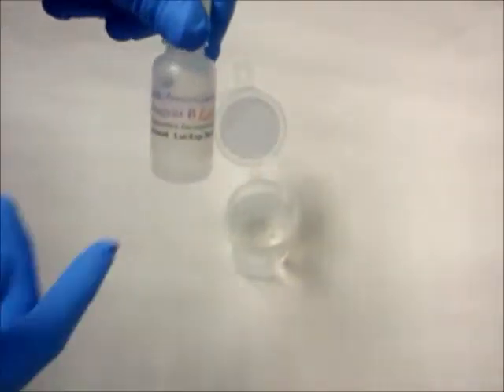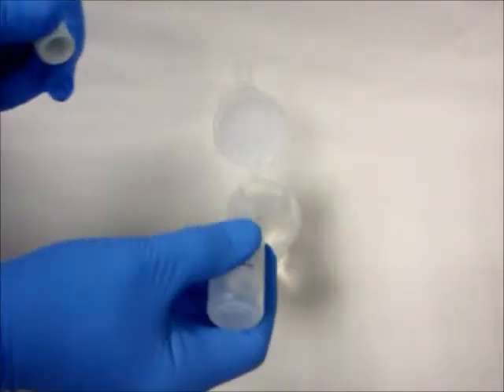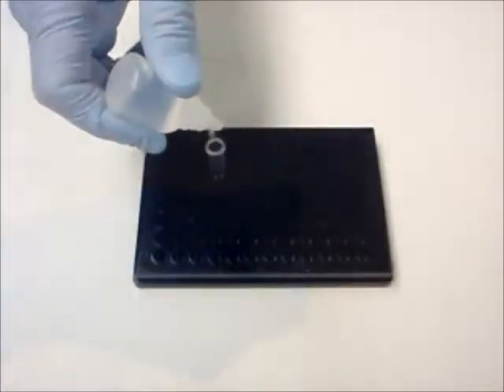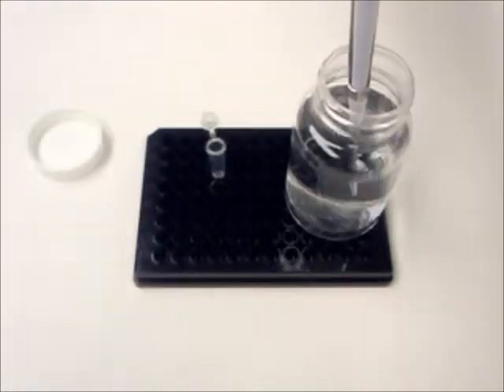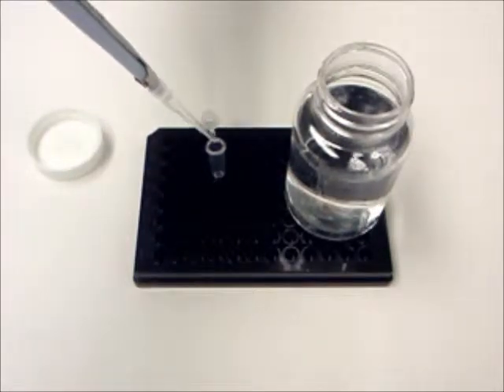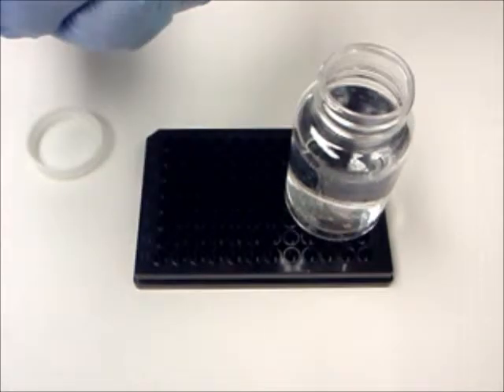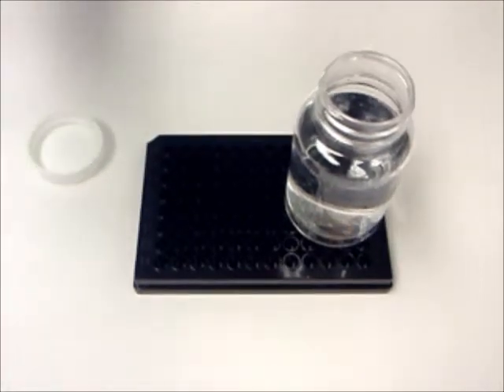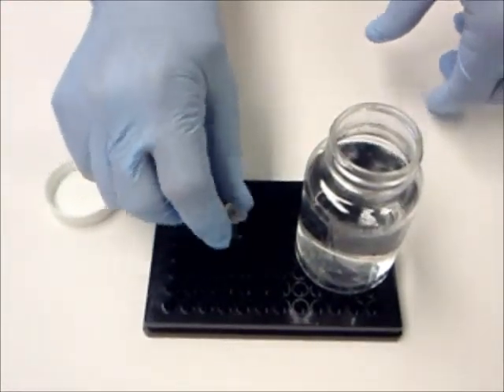First, collect your 100ml sample and add 4 drops of Reagent B, the enzyme inducer. Add 3 drops of Reagent C, the lysing agent, to the plastic mixing vial. With a disposable pipette or pipette tip, pipette 175 microliters of the liquid sample from the 100ml container into the plastic mixing vial. Secure the lid and gently shake.